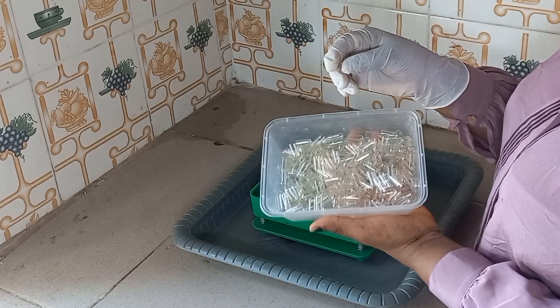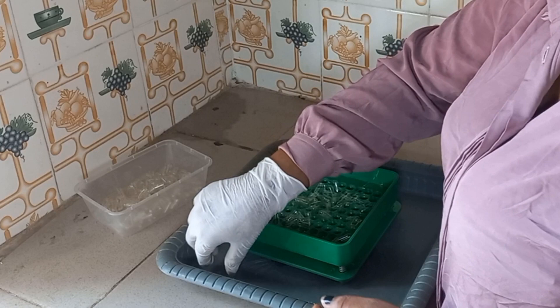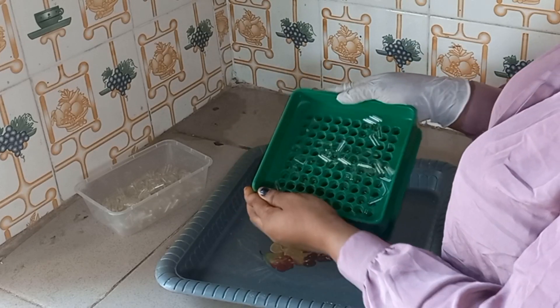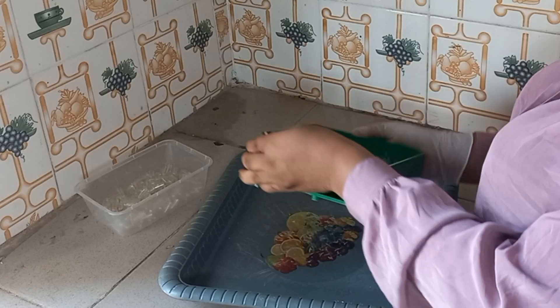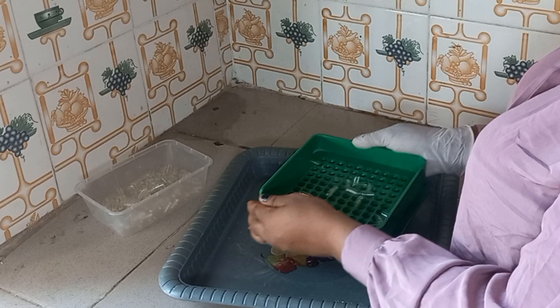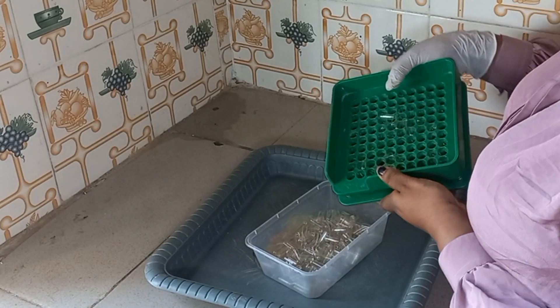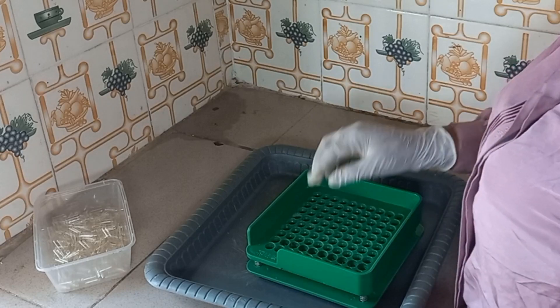After placing the rack, I'm using my gelatin capsule — I'm using the larger part of the gelatin capsule. The capsules will fall inside the bowl; not everything will fall in perfectly. Some might fall upside down, so I'll just remove those.